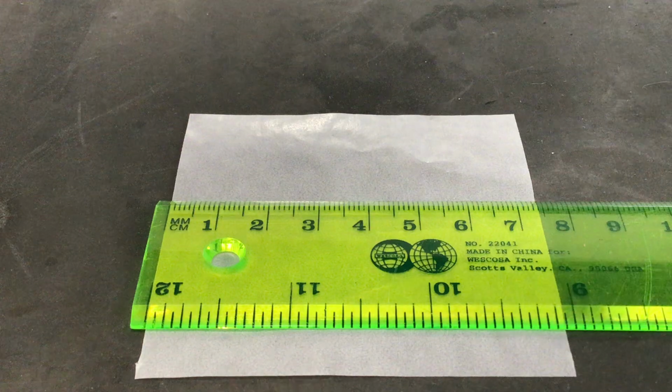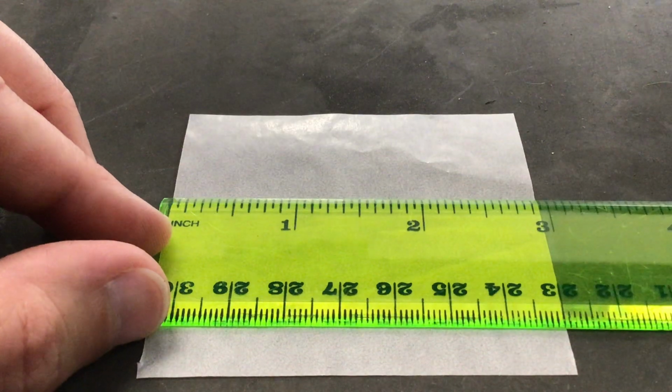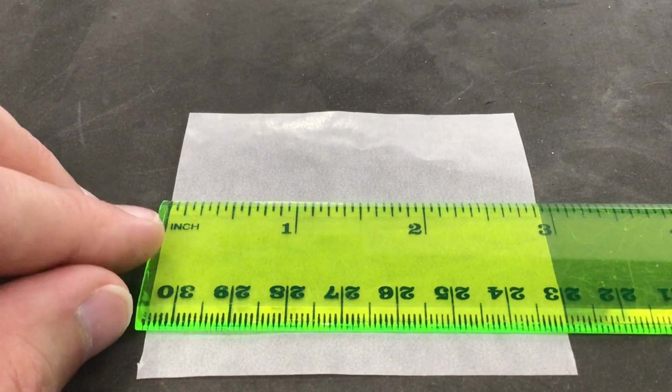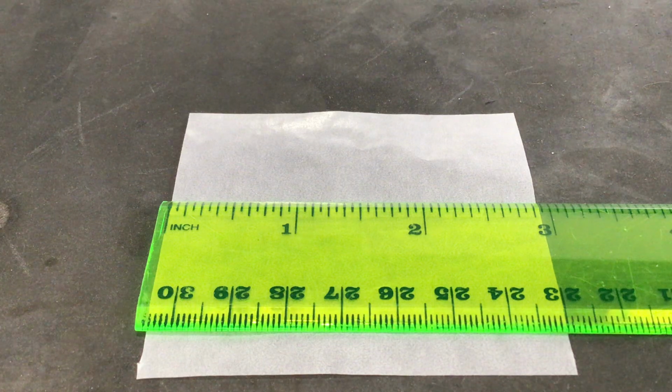Now, if I was to flip this and look at the inches side of the same ruler, it's a little more complicated, particularly when it comes to significant figures. And it's why we tend to not use them as often in a lab setting, because it's a little more awkward to make precise measurements with. If we notice here, the tick marks for inches aren't every 1/10. So everything's not divided into 10 pieces like it is for normal SI units in the metric system.